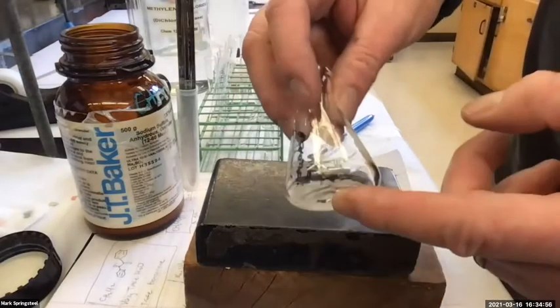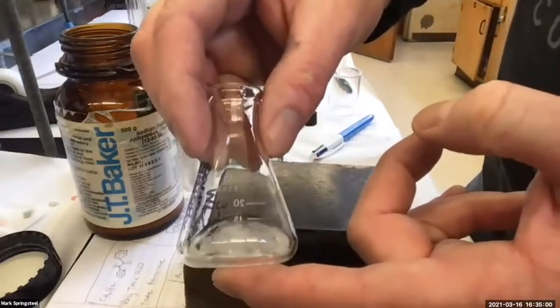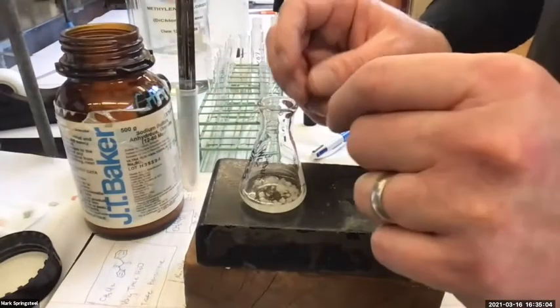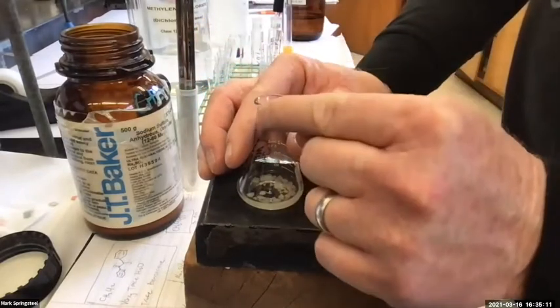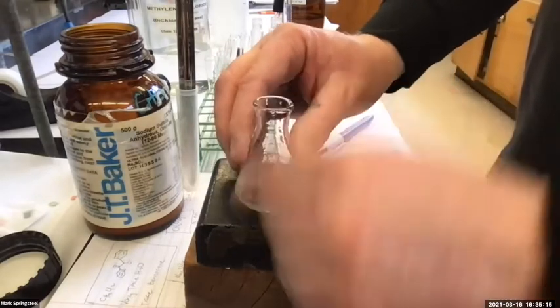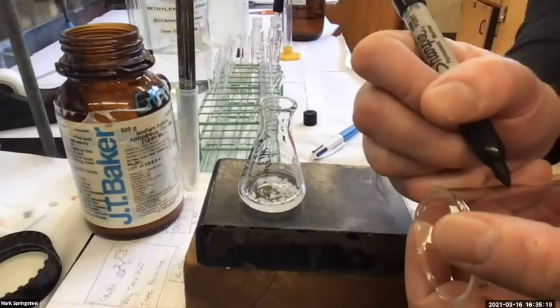Well, you can even see now. So I have dry methylene chloride. See how it doesn't really stick to the glass? You don't see beads of it, like a Coca-Cola commercial where you see a cold glass of Coca-Cola and a water droplet slowly, seductively sliding down the outside. If you have a droplet of methylene chloride on regular glass, it just falls instantly because it's not attracted to it.